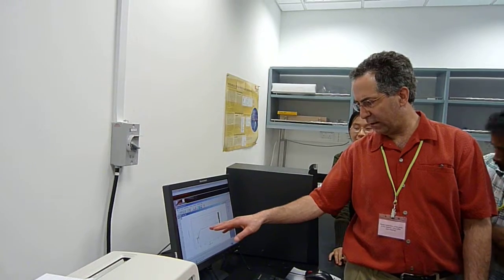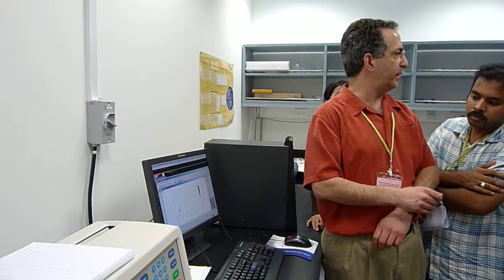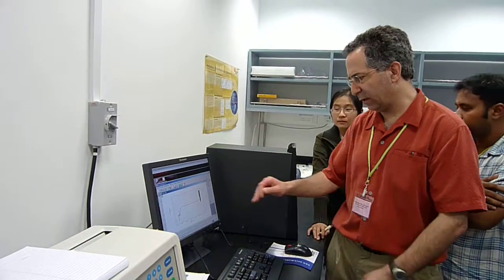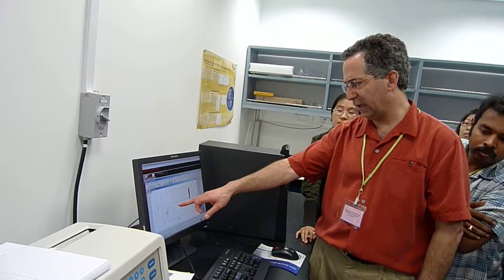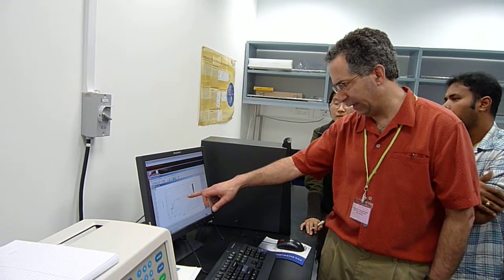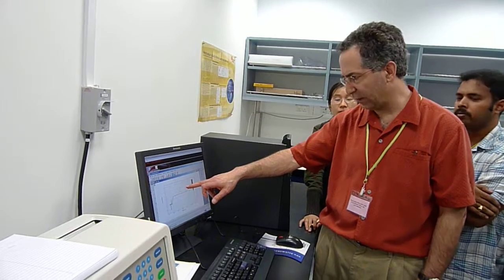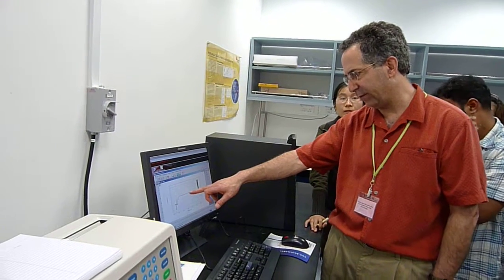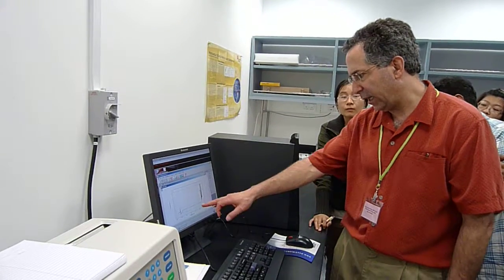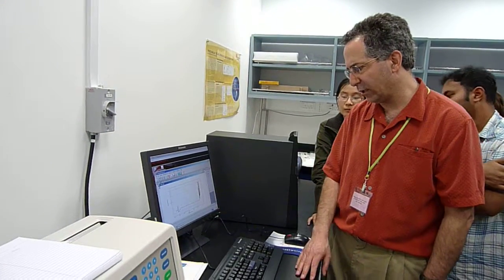And we wanted an OD. I think originally I thought the OD was 1, but then you mentioned it was about 1.4 or something. So when you multiply that by the 1.2 centimeters, we should end up with an OD around 1.8, but we're probably about 1.4. It's actually a little bit less, but it's in about the right range.